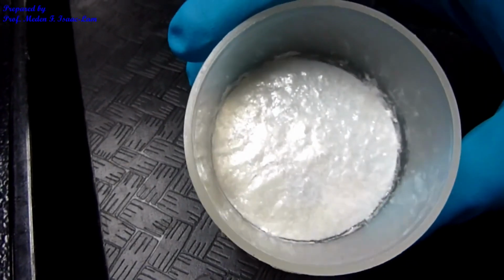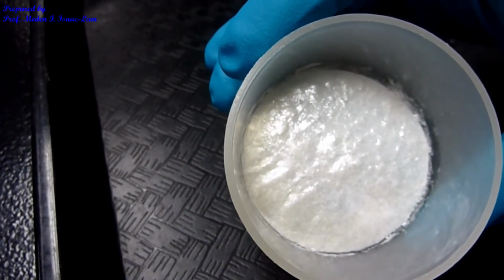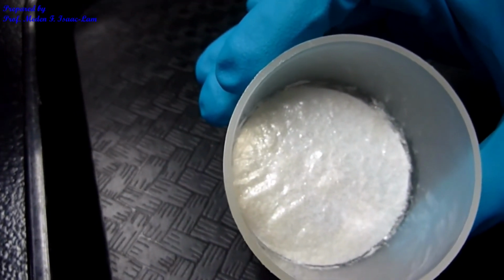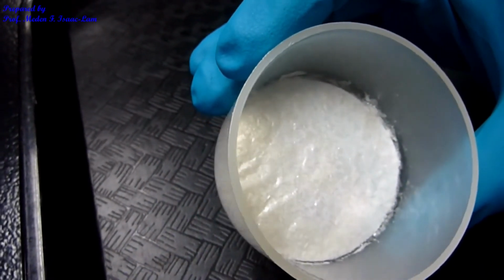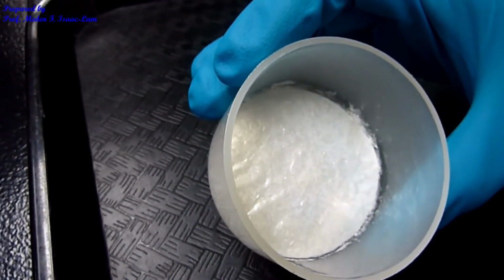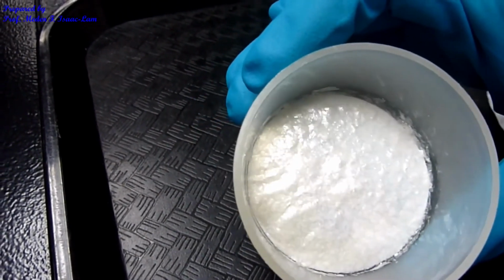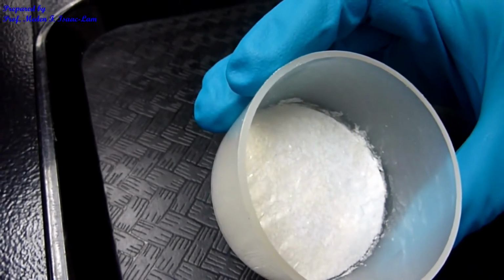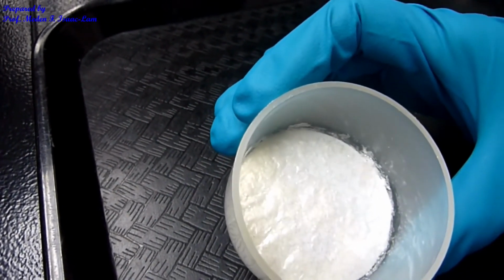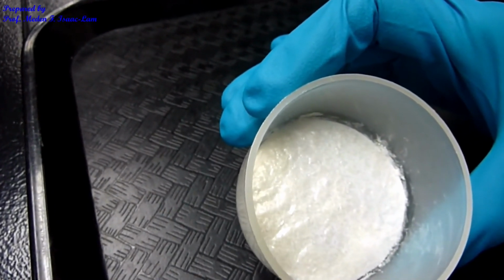This is now the sample a week after drying. So technically, you do this in the next lab period, which is going to be a week later. So you're going to be drying this the same way. I dried it for a week, and you see that the crystals are actually shiny and it's still stuck to the bottom. So I'm going to take out the filter paper with the sample, and then I'm going to weigh the sample. So remember, we had the weight of the filter paper.